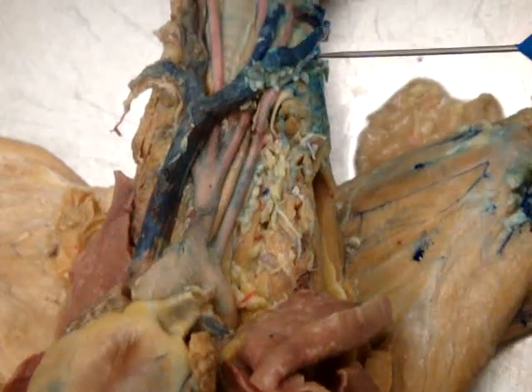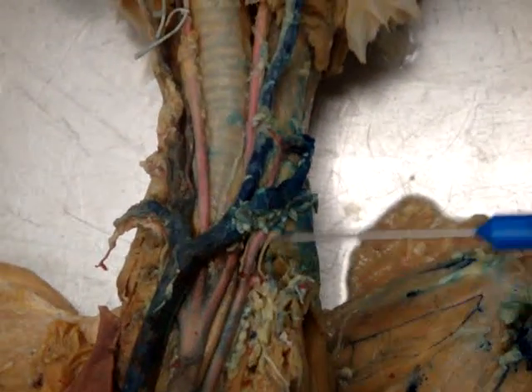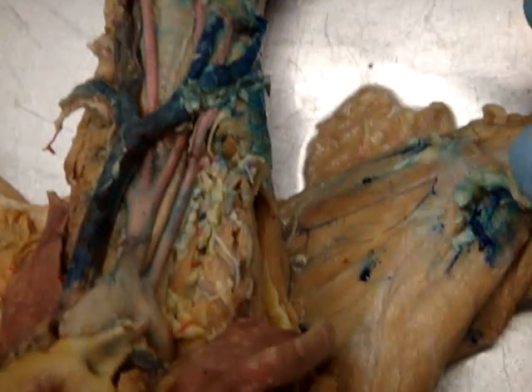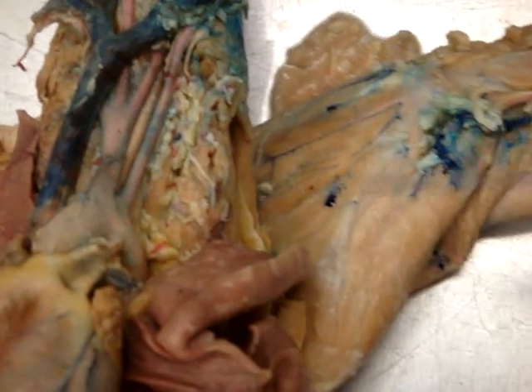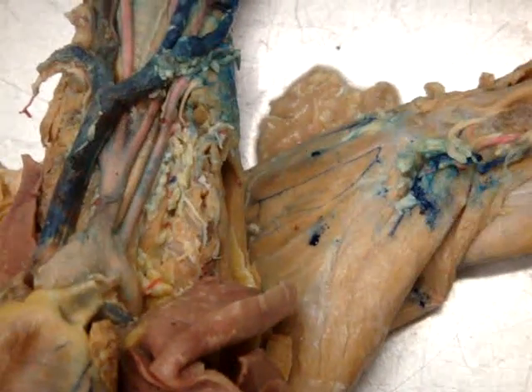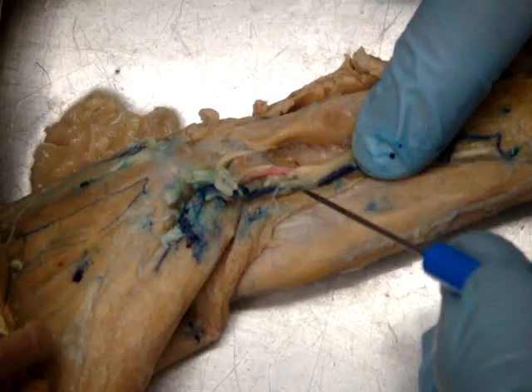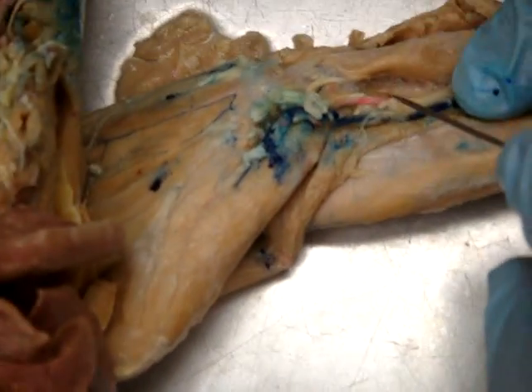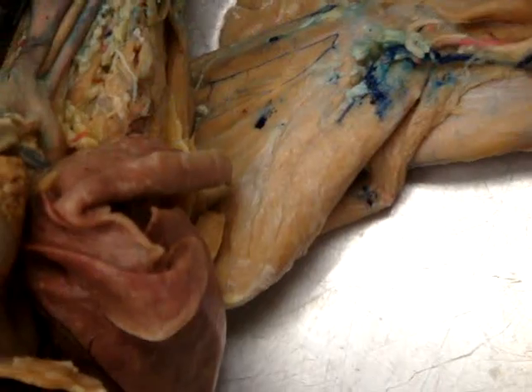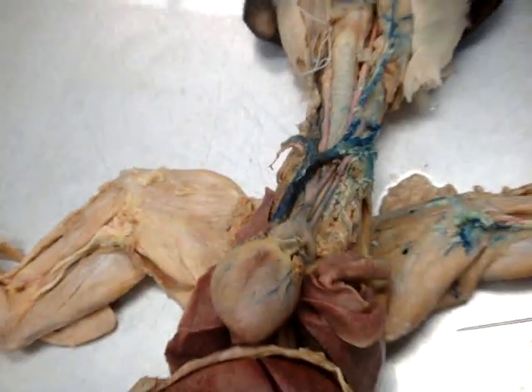You can't see where the mammary comes off of it — the left mammary — but that would continue up and make the left axillary also. And then here, connected to the left subclavian would be the brachiocephalic artery, which is kind of hard to see. We can't see how it connects.